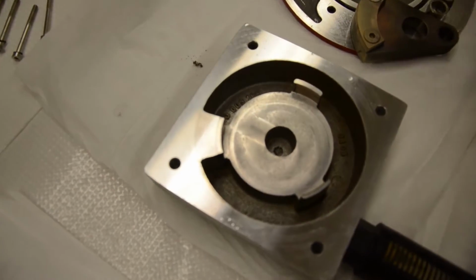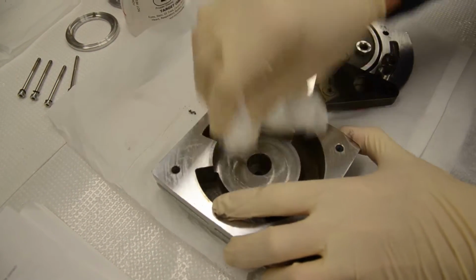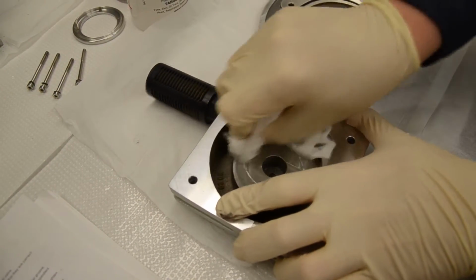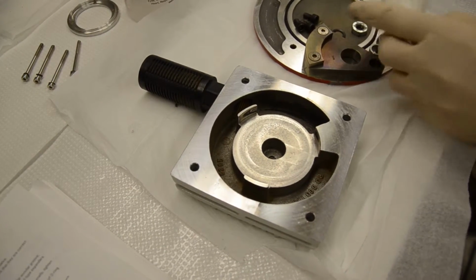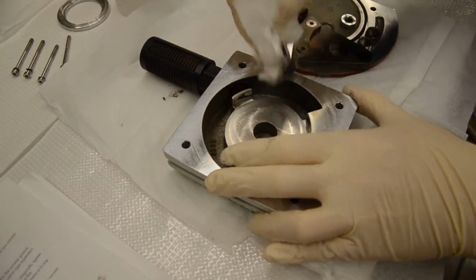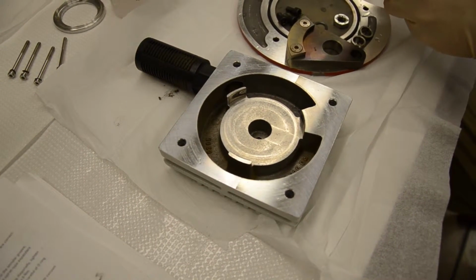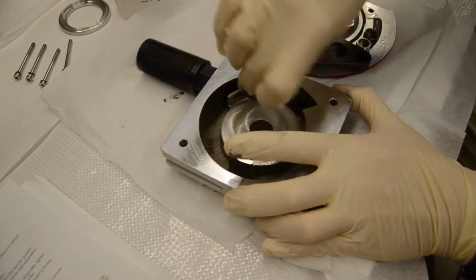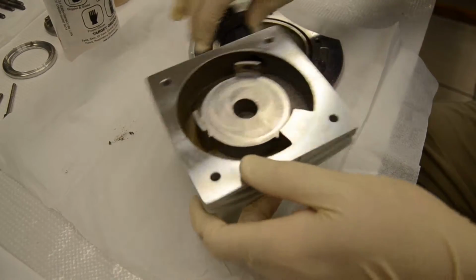They do have Teflon on these 3 pieces. There's a little patch of Teflon that can get rather soiled sometimes. In this case, even worn off, which could explain why we've had so much wear and so much black debris left behind. This pump is probably 5 or 6 years old. Chances are they're not really designed to last that long. So basically that's kind of a clean cavity.